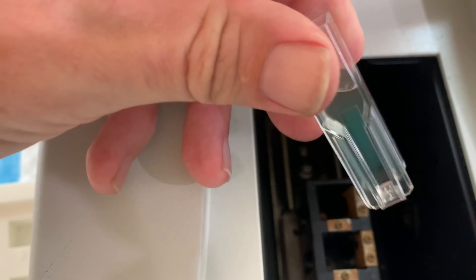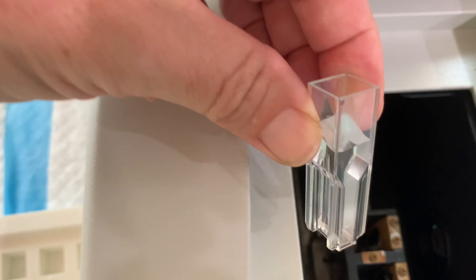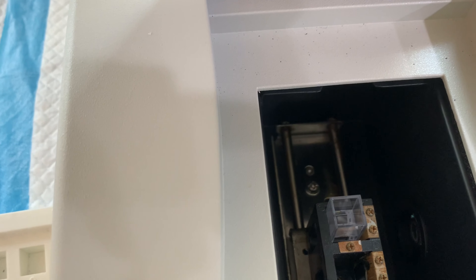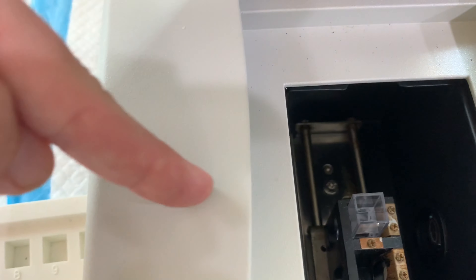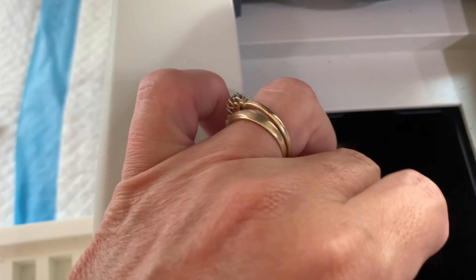They're designed to hold 2mL plastic cuvettes — here's one right here. This plastic cuvette has an arrow on it; you see that arrow right there? That arrow is an orientation marker. It tells you the arrow goes in towards where the light is going to be coming from, so the light comes out of the emitter, passes through the cuvette, and the amount of light passing through is picked up by a detector on the other side.